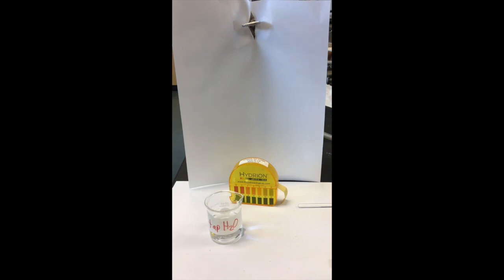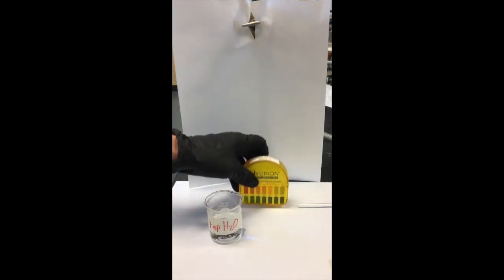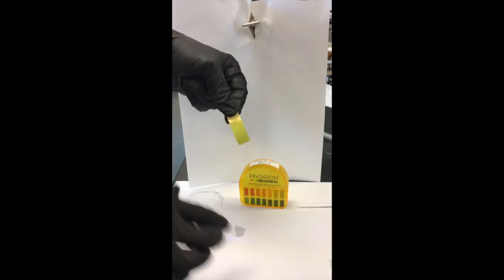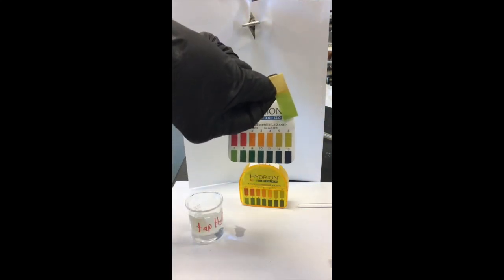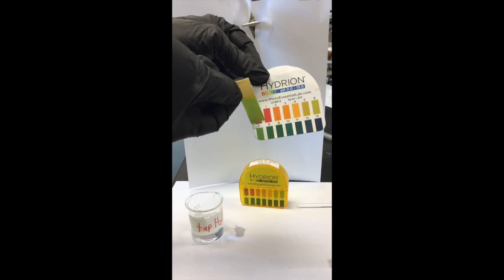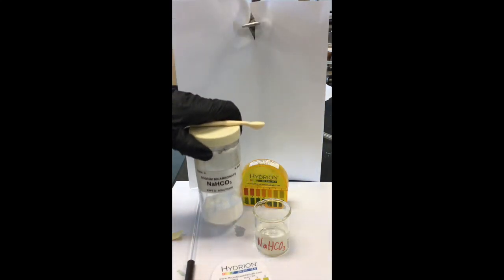For Part 3, we'll be determining the pH of a solution using pH paper. Take a piece of pH paper off the roll, dip it into your solution — the first one is tap water — get the paper wet, and then compare the color the paper turns to the scale on the box. Looking at this example, the number it matches most closely is 7. The next solution is sodium bicarbonate, also known as baking soda, which is a solid.